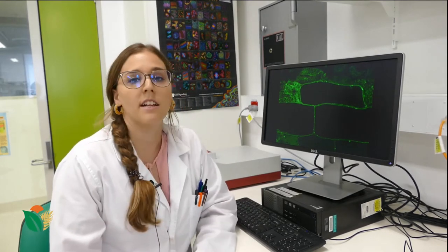With the confocal microscope we're able to get really high resolution, sharp images of living cells. This is a great advantage because we're interested in knowing where the aquaporins go within the cell, and depending on where an aquaporin is found, this has implications for its function.